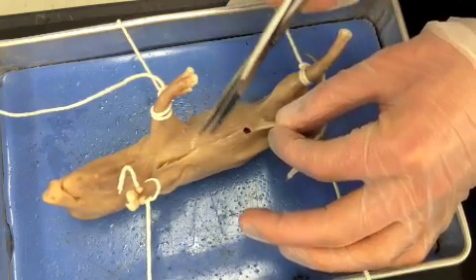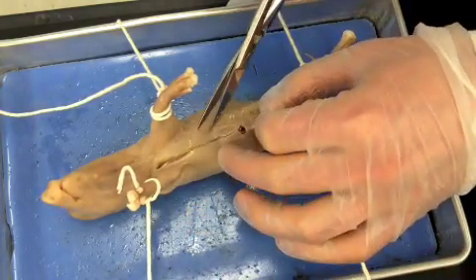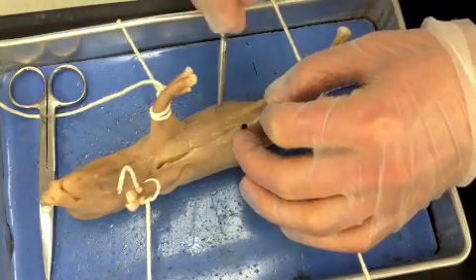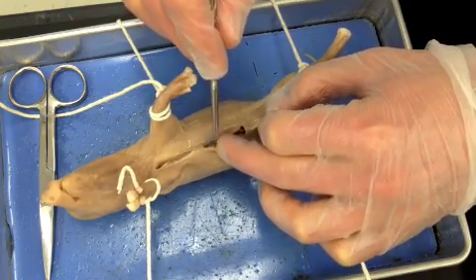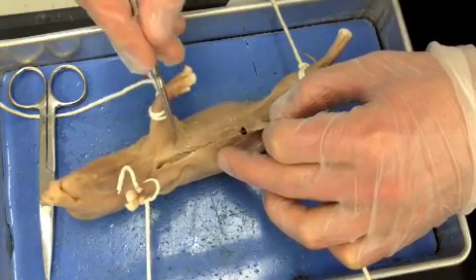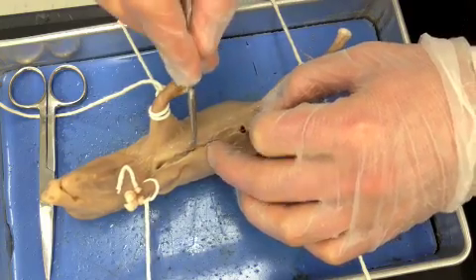Notice that Mr. Rowan doesn't put that bottom blade too far into the pig's internal organs — it's better to be cautious. You can see he's started to go through the skin, and you can see this white, shiny tissue — it's called connective tissue. He didn't go deep enough here because you're not seeing any organs yet, so he stayed on top of the surface to play it safe.